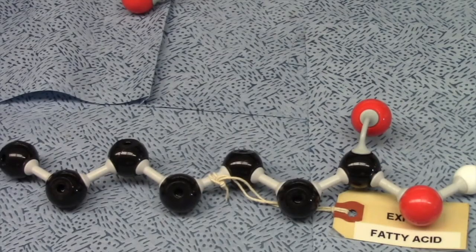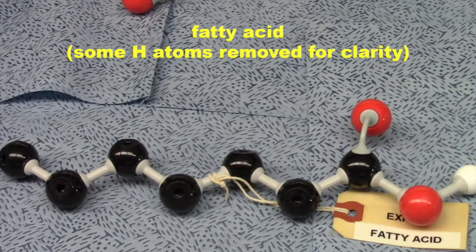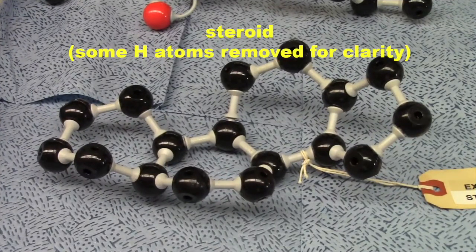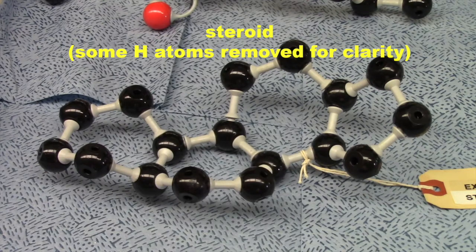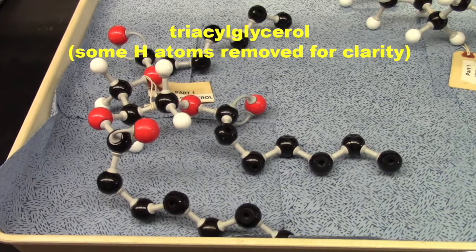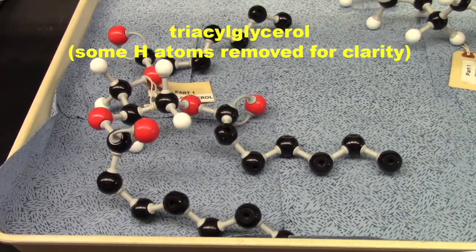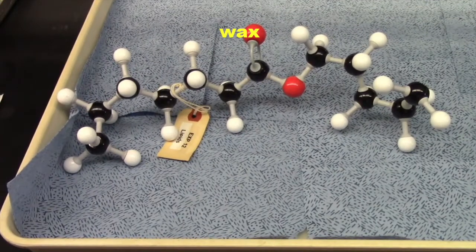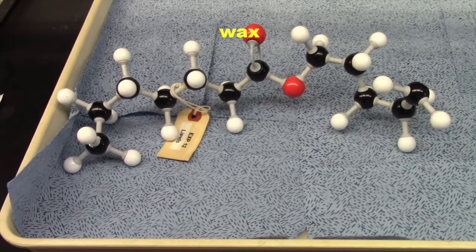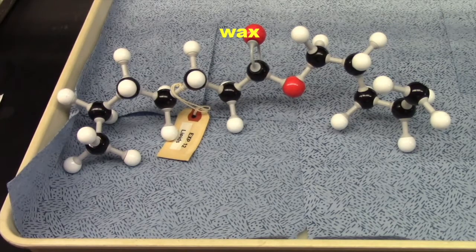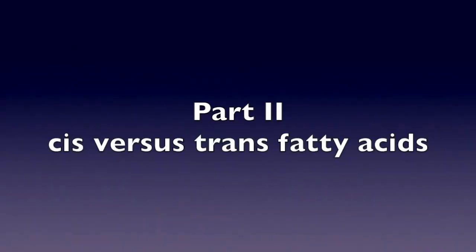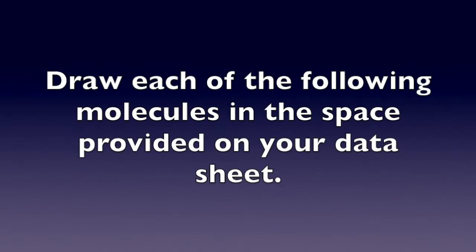Alright guys, we'll be starting with part one, identifying lipids from a molecular model.